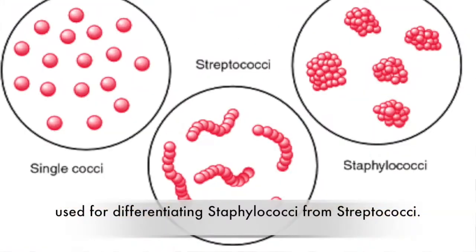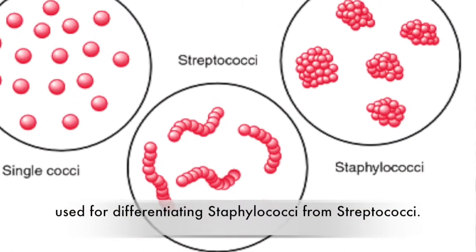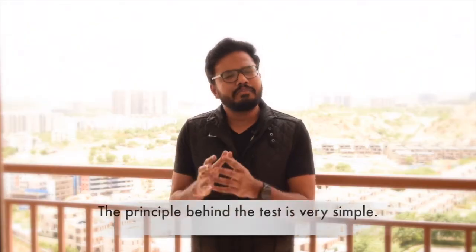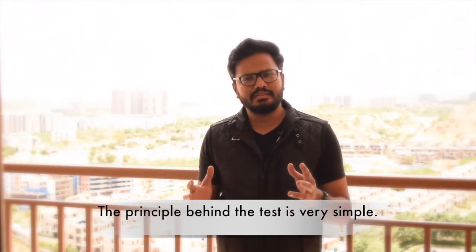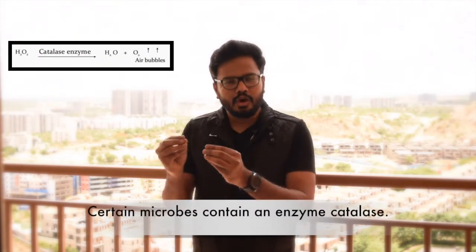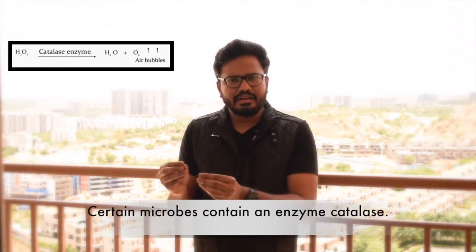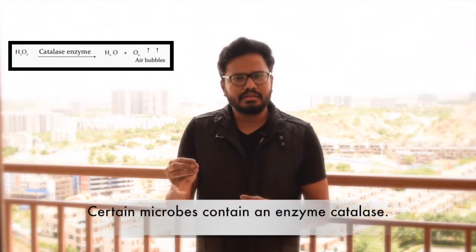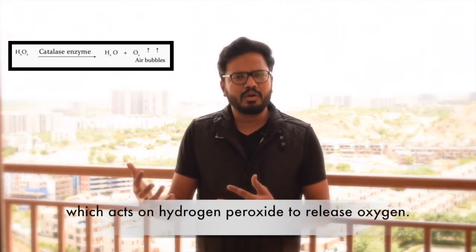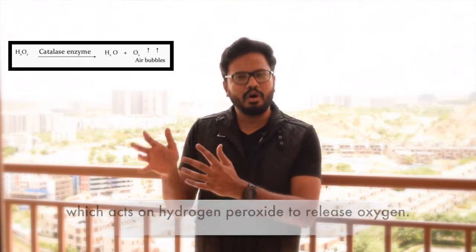This test is mainly used for differentiating staphylococci from streptococcus. The principle behind the test is very simple: certain microorganisms contain an enzyme called catalase, which acts on hydrogen peroxide to release oxygen.